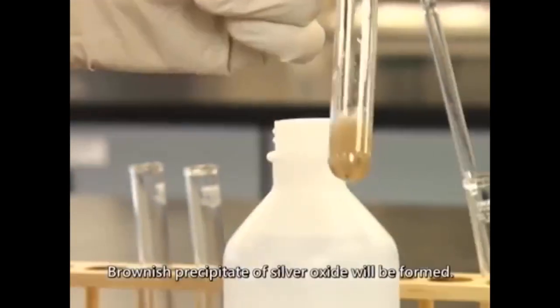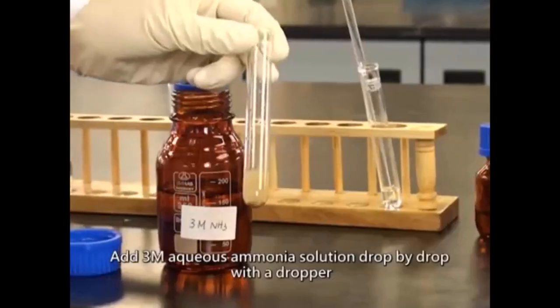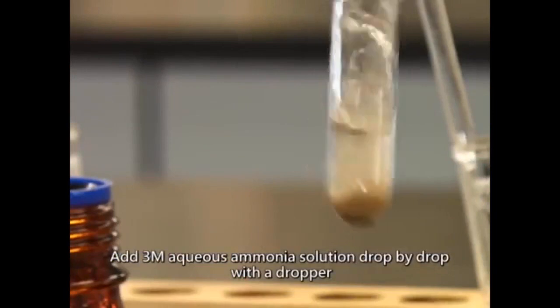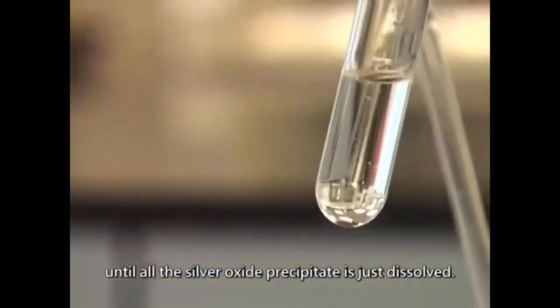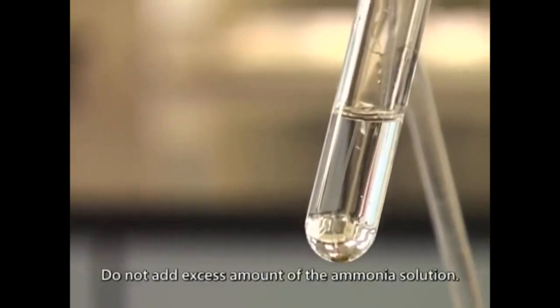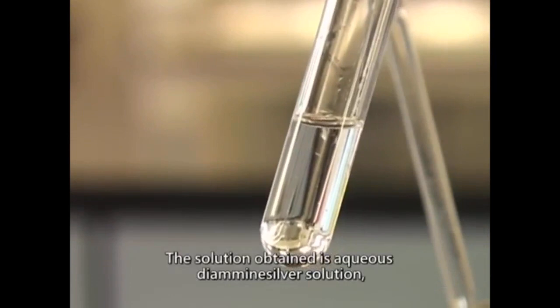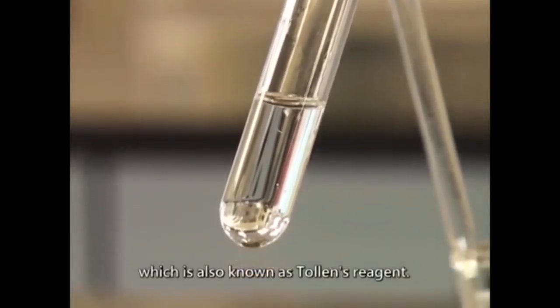Brownish precipitate of silver oxide will be formed. Add a 3 molar aqueous ammonia solution drop by drop with a dropper, until all the silver oxide precipitate is just dissolved. Do not add excess amount of the ammonia solution. The solution obtained is aqueous diamine silver solution, which is also known as Tollen's reagent.